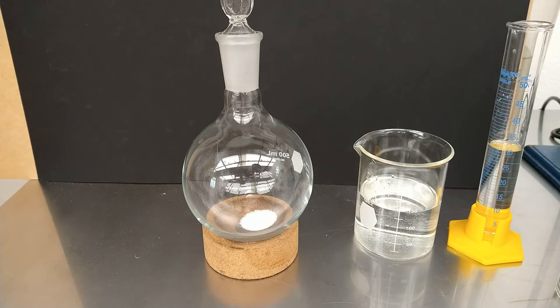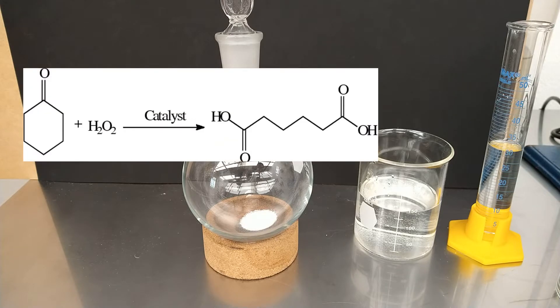Hi everyone, so in today's video I'm going to show you the synthesis of adipic acid by the catalyzed oxidation of cyclohexanone by hydrogen peroxide.